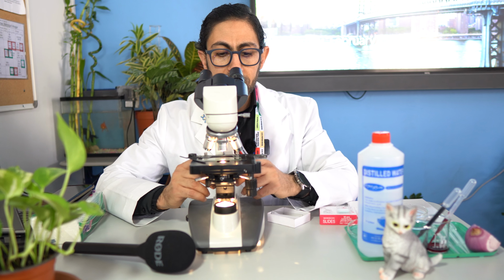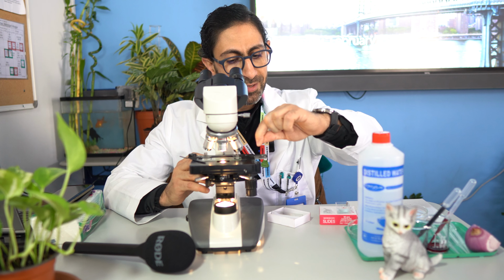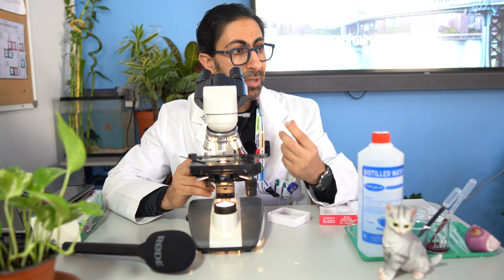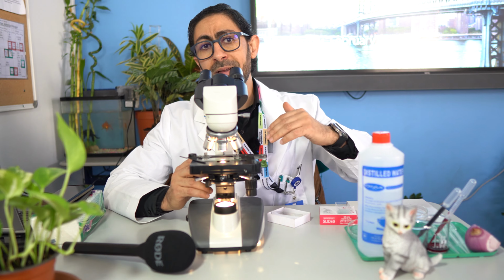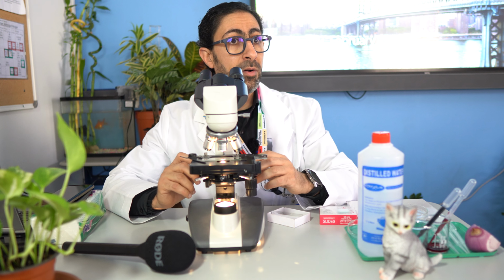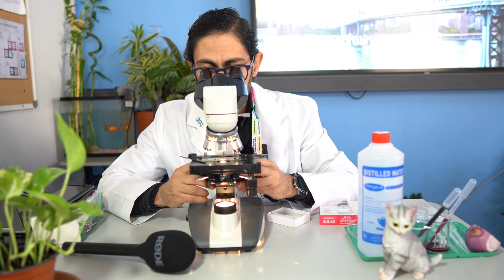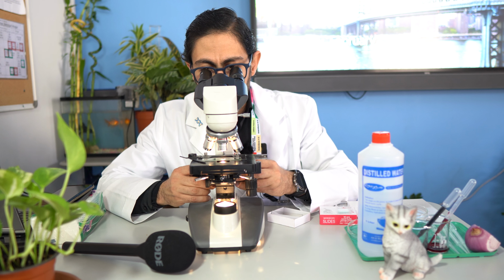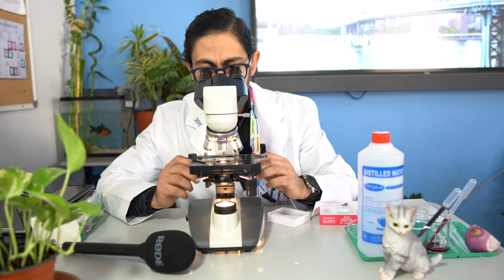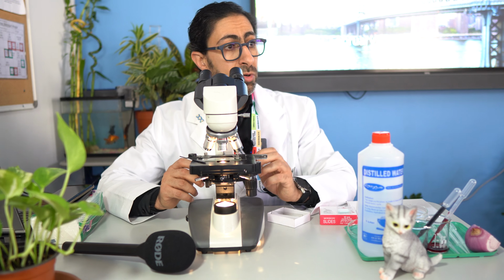Afterward you will move the coarse adjustment, moving the stage downward, away from the lens, till you have the clearest image that you can see. It will not be very clear, because the job now is for the fine adjustment. You got it? Afterward, you move the stage a little bit downward, then you will have a clearer image. Then you will manipulate the fine adjustment to find the best resolution.